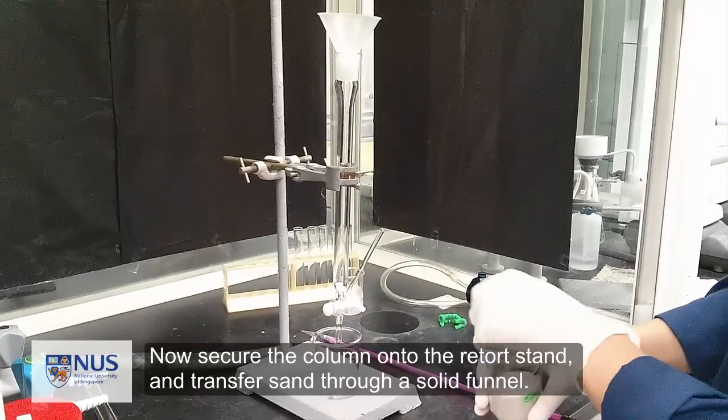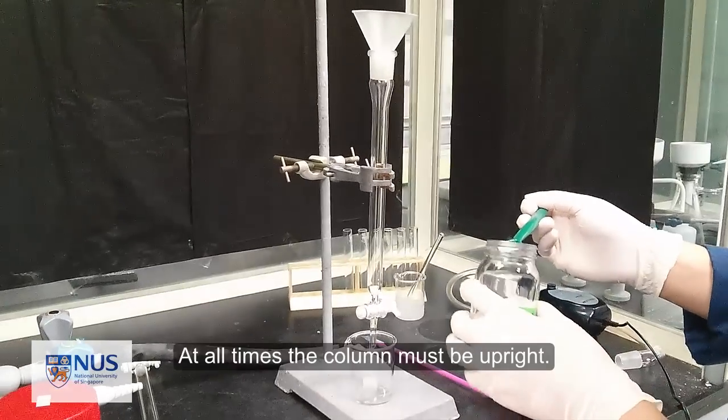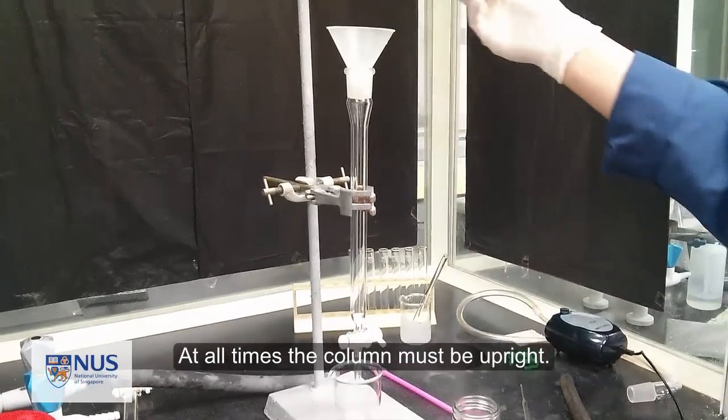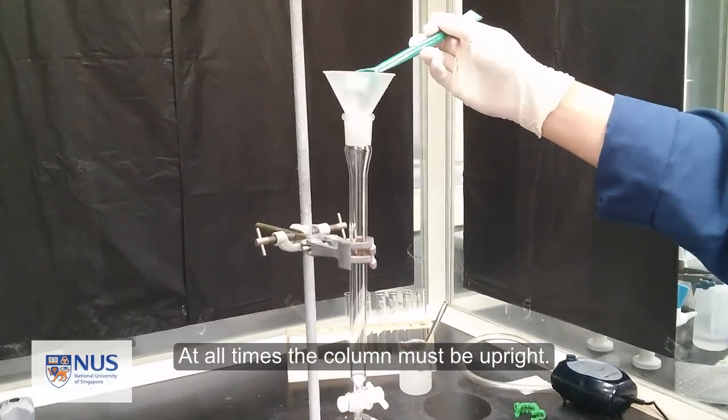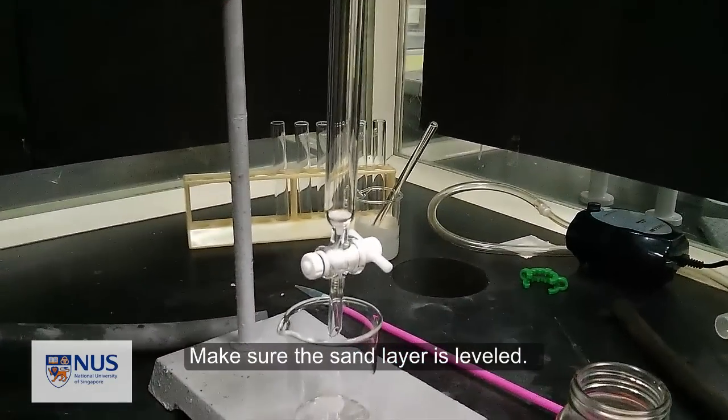And transfer sand through a solid funnel. At all times, the column must be vertical. Make sure the sand layer is leveled.